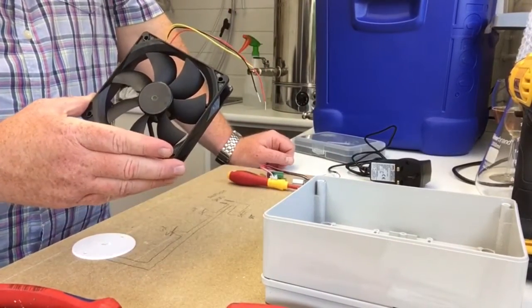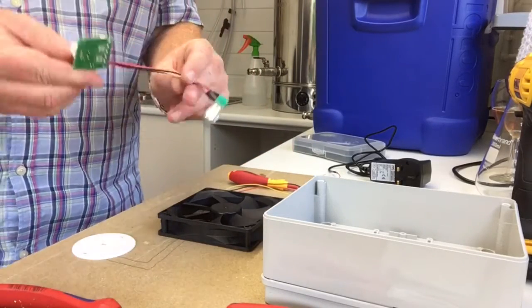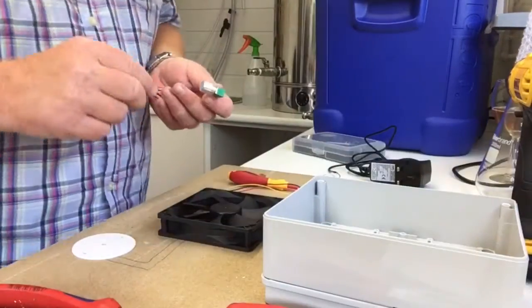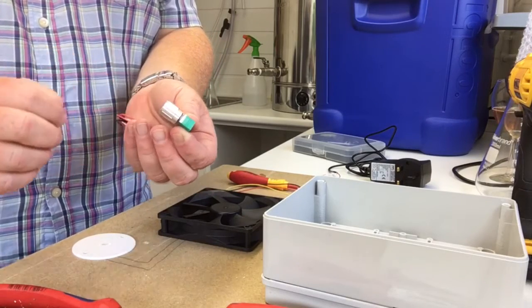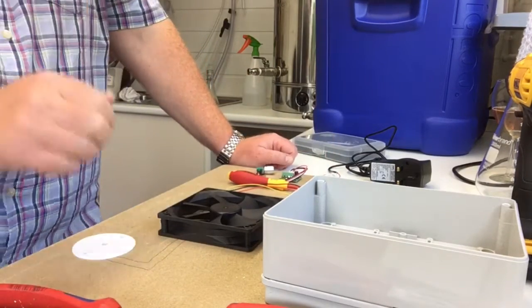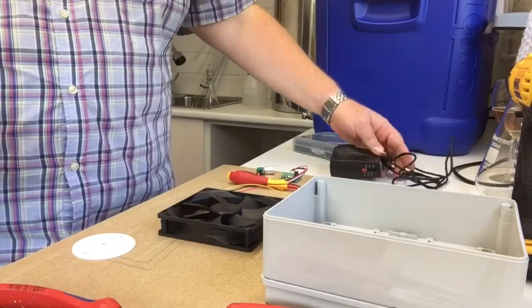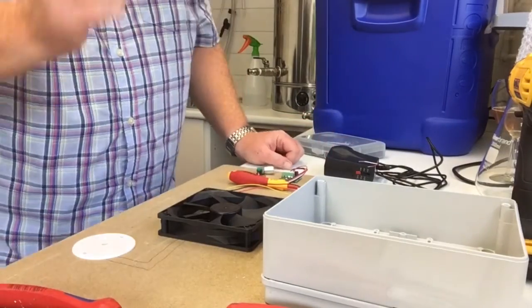I've got a PC fan, a little voltage controller. I was also going to put a little switch, but I forgot, don't need to, because these little voltage regulators have got an on-off switch on them, so happy days. And obviously, goes without saying, a 12 volt DC power supply. This is a multi-voltage one, but it's the only one that I had.